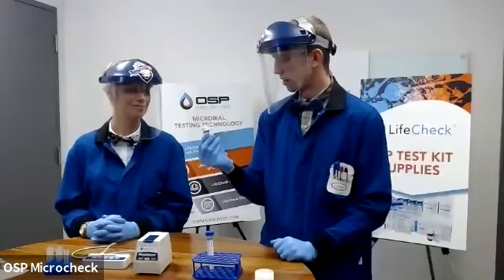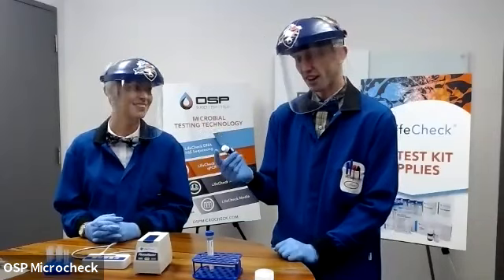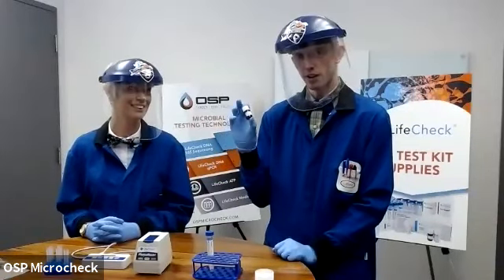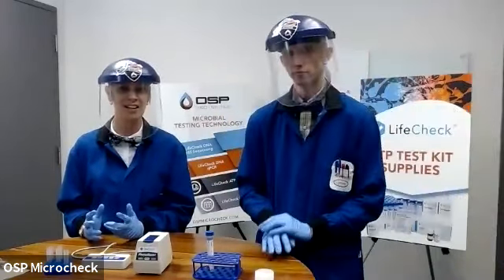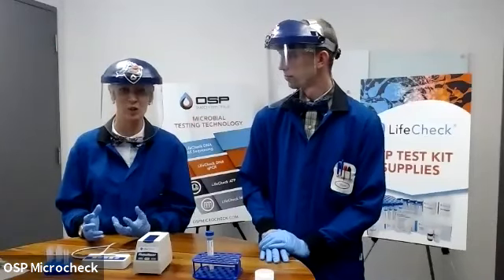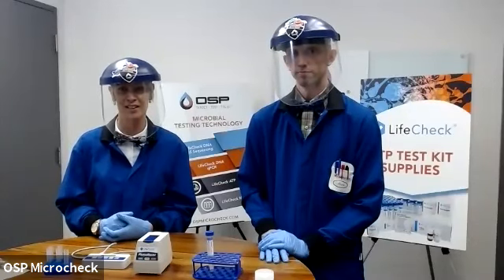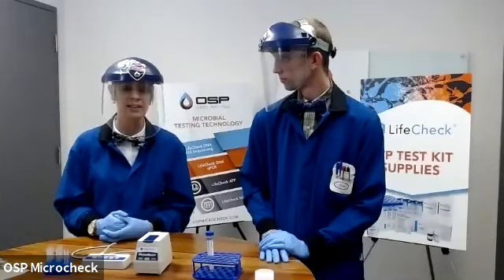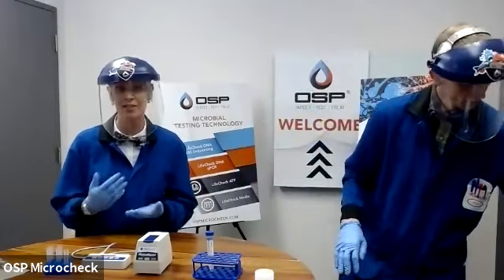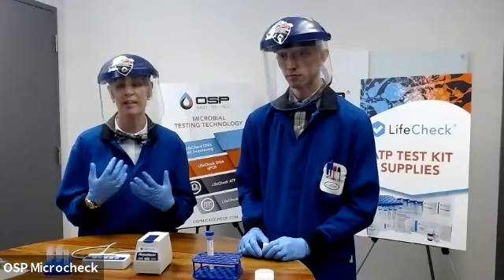If these enzymes are left out in the heat and say the dash of your truck, what happens, Virginia? They degrade very quickly. Right. So we want to make sure that this guy is happy and healthy and ready to go for testing. So these enzymes are very much like what you find in fireflies. So it's a synthetic version of that. And for anybody that is in our Texas crowd here, again, that heat and working out in the field, that will degrade it very quickly, like within hours. So that's part of the reason why we have that first step, so that you can stop and take it to a facility that has temperature control. Otherwise, I would suggest between every use, toss it into a cooler or an air-conditioned environment.